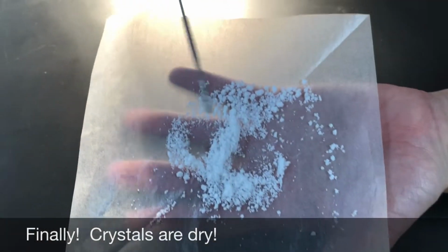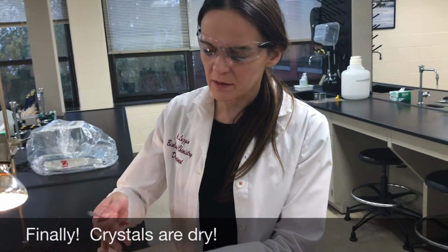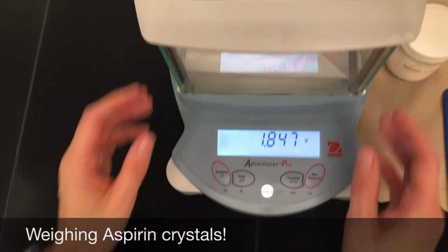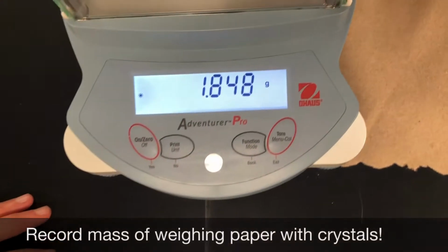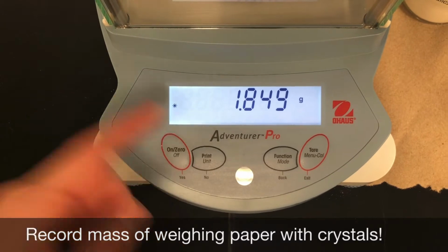Okay, so you can see that the crystals are not as clumpy anymore, and if I touch them, they don't stick to my fingers, so that means they're pretty much dry. So this completes the synthesis portion of the lab.